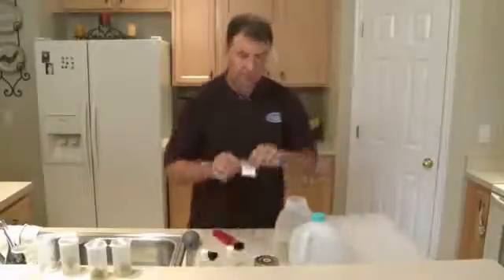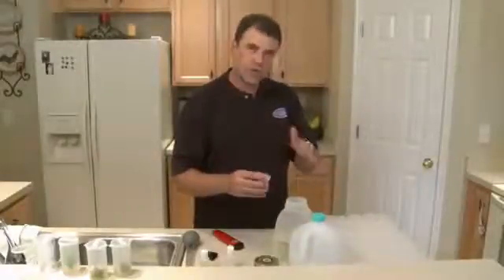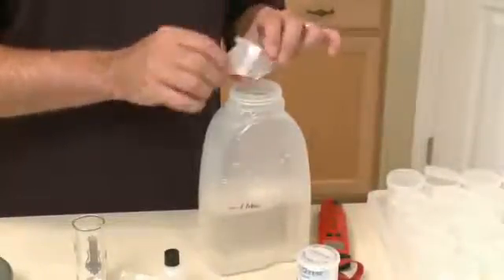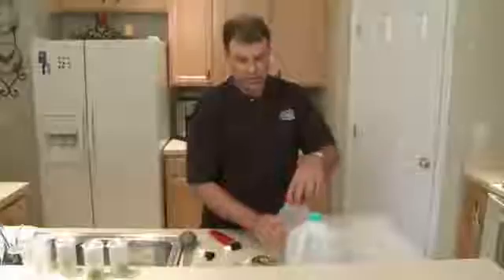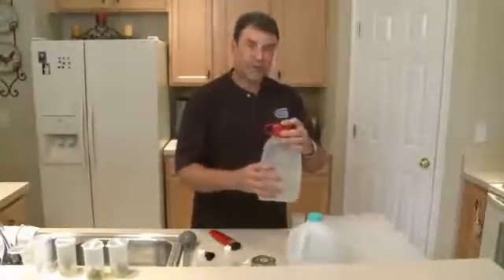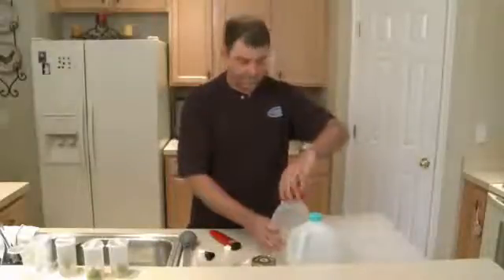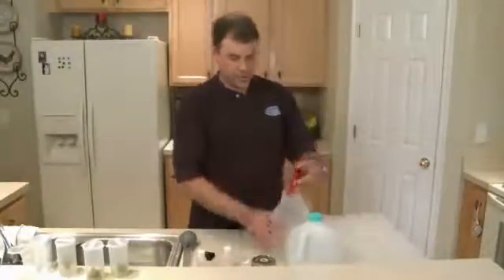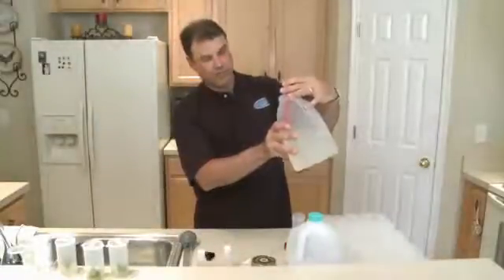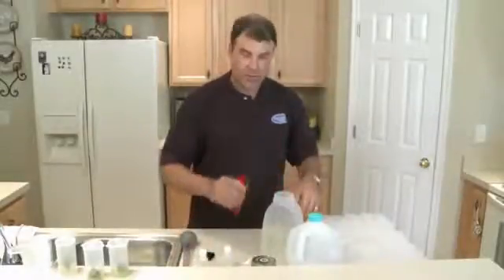That's my first pH test — I wanted to do that before adding the gel powder, because sometimes if the pH is too low before adding it, the powder won't set properly when it finishes. So I've done that first, and now in goes the gel. The value of this container will really be seen once everything is mixed and we go to fill all our containers. One more pH correction and we're ready to dispense — we're at 5.6, so I'm not going to mess with it much. One drop, and we're ready to go.